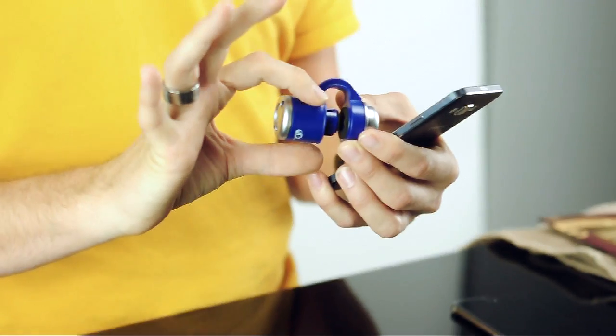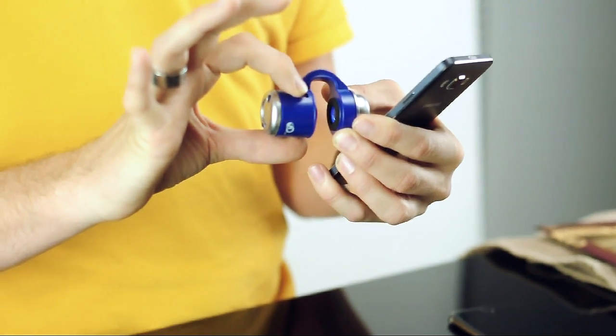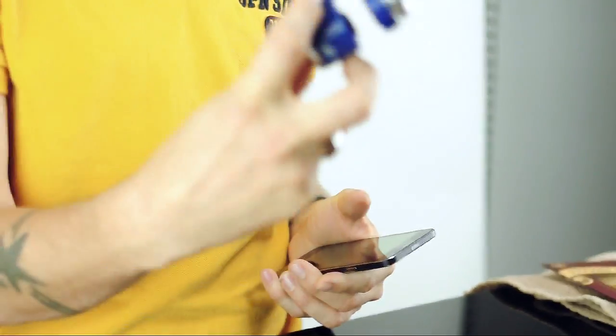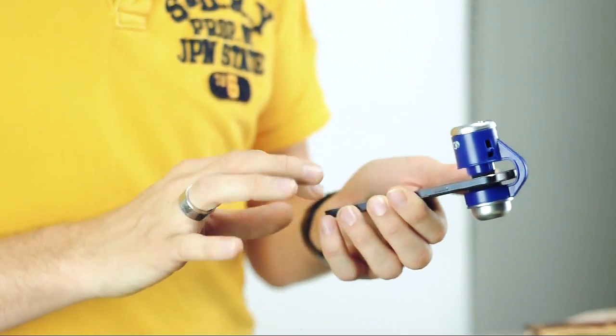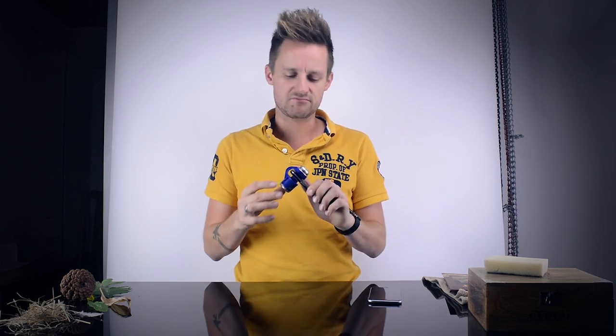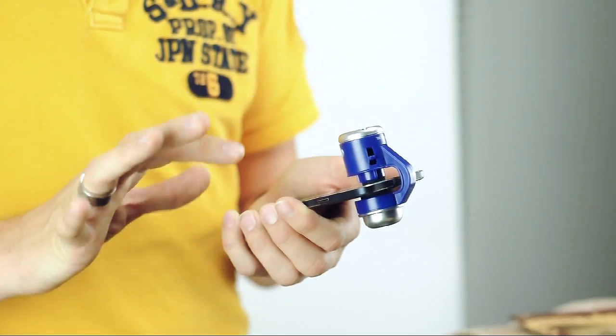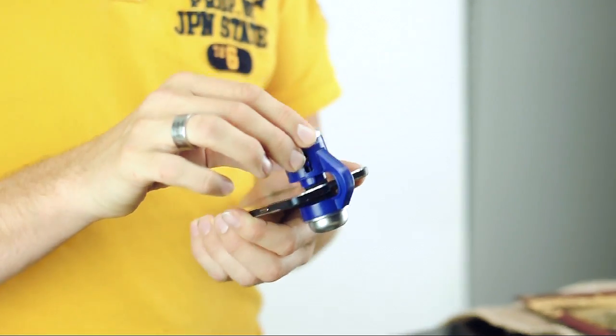It looks like this. To the sides you've got a couple of bars that you need to hold onto and pull back — that's what's going to secure it in place on your phone. So pull those back, locate your camera, and slide on over. Simple as that. So now the microscope's in place. People have asked whether this is Bluetooth linked or some kind of clever business like that — it's nothing like that. It's a very, very simple lens to slip over your standard camera phone.